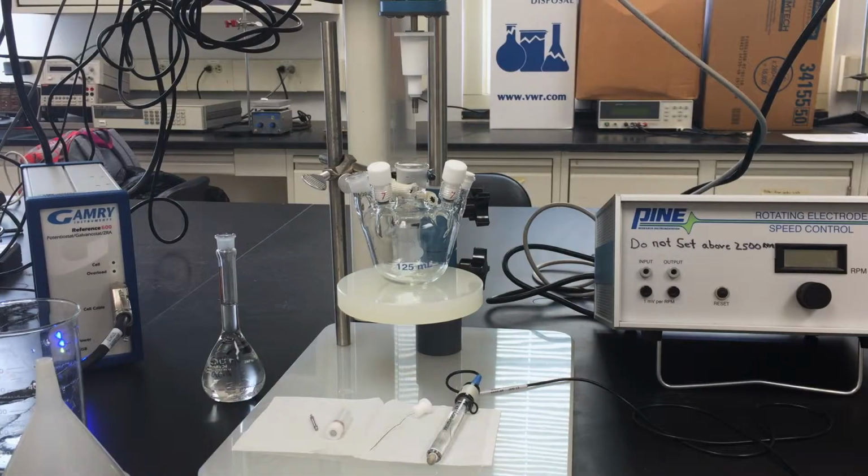Cell assembly. In this section of the lab video, we will demonstrate how to properly assemble an electrochemical cell for corrosion studies. First, all electrodes and the glass cell must be cleaned, rinsed, and wiped dry using the proper procedures established in previous videos.